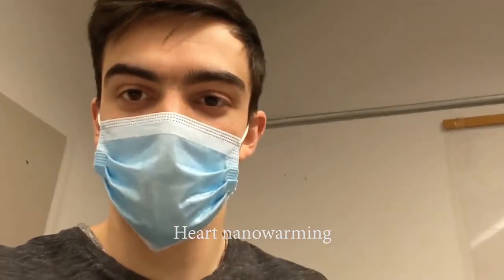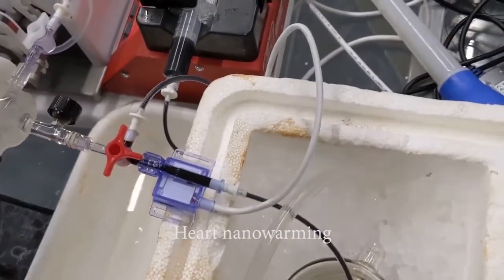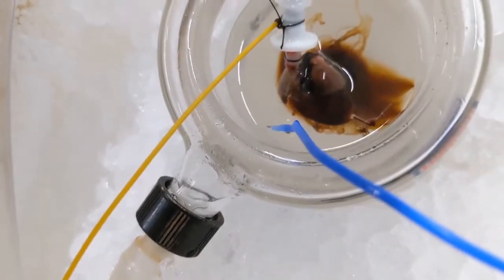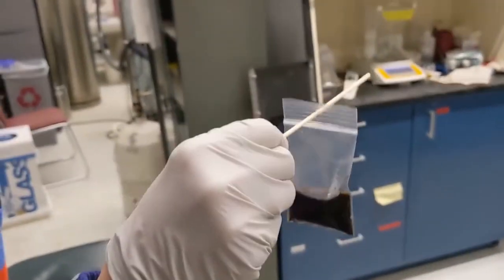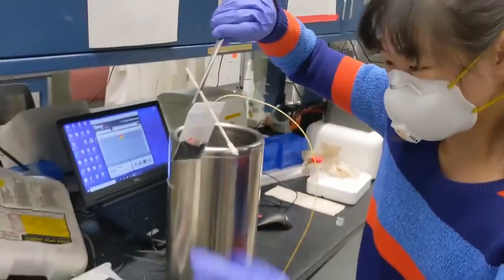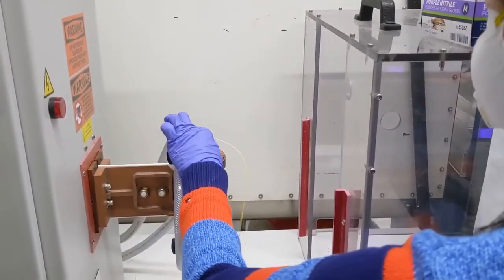Alright, so my name is Casey. So here I'm just showing the iron oxide nanoparticles getting loaded into the heart. Up through here, through the aortic cannula, and exiting through the catheter and pulmonary artery. This is Z. After this step is complete, about 4 mils into the heart, she'll put it inside this bag here, which will then be placed inside the control rate freezer. And after that gets vitrified, we'll rewarm it by placing it inside this nanowarming coil.